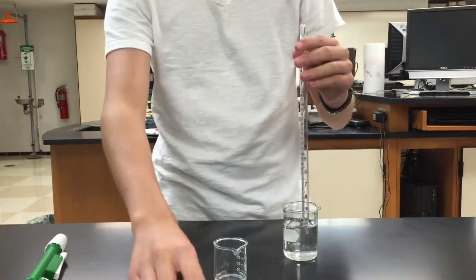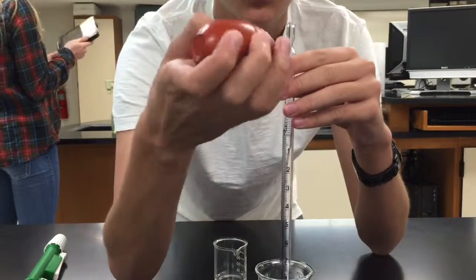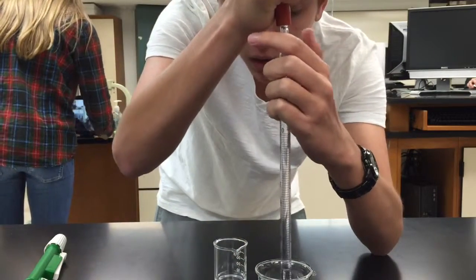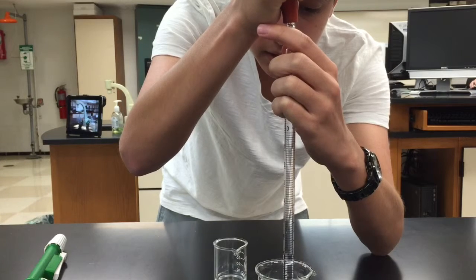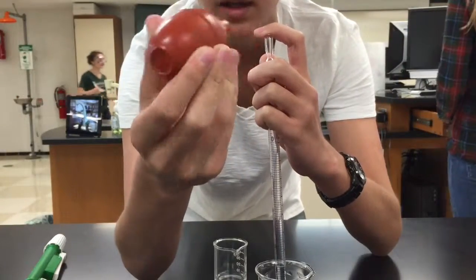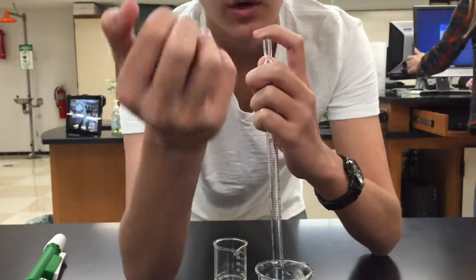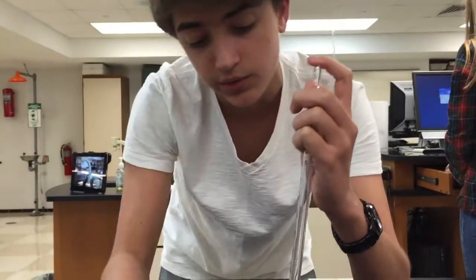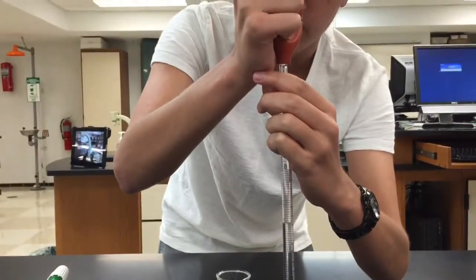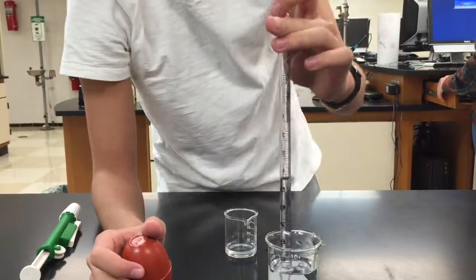Make sure you wash everything after you use it. But if you're confused on how the bulb works, it's a little bit more difficult in my opinion, but you basically have the same setup. What you do is you squeeze the bulb so that there's no air in it, attach it to the top of the pipette and slowly let go so that it gets pulled up into the vacuum. When you push this in, there's not enough air in it. So it needs to fill with air when you let it go. What it's doing is it's taking that suction and just applying it to your pipette. So it pulls the water up into there or chemical. In my opinion, I like to use the pipetter better, but that one worked really well. I got it to the one mark. So that's basically all you need to know for pipetting.